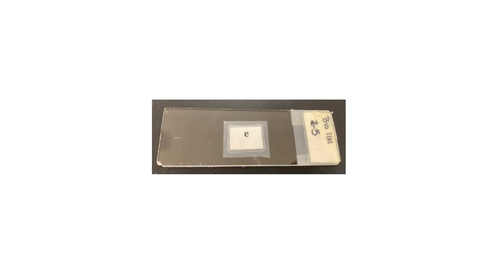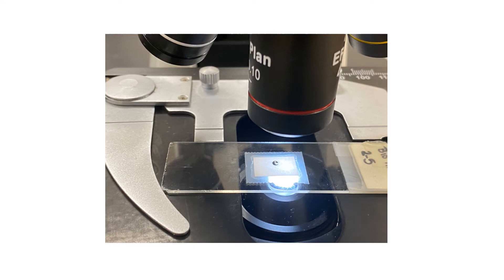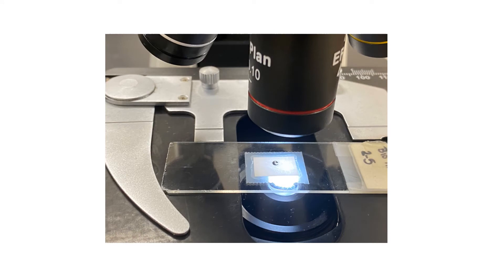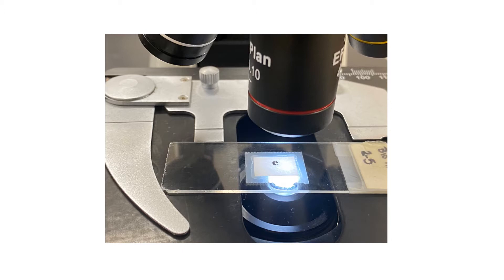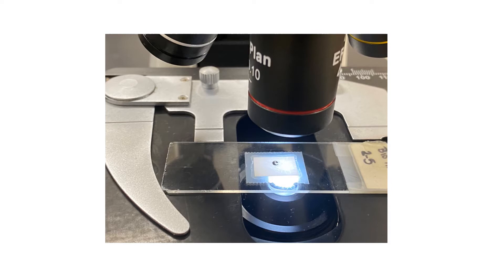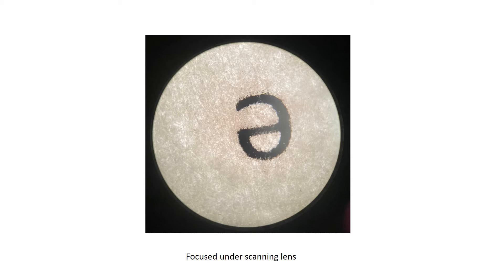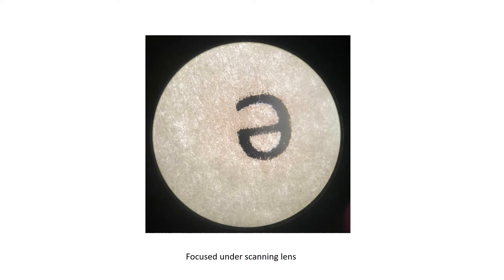We will first start with the slide with letter E. Place the slide on the stage, secure it with the clip, and then focus it with the first objective lens — the scanning lens — at power 4x. This is how you should be able to see the letter E if you focus it properly.